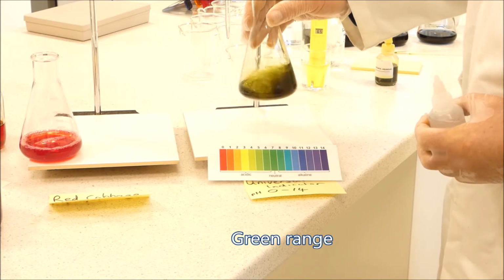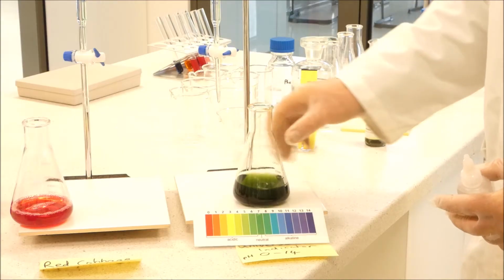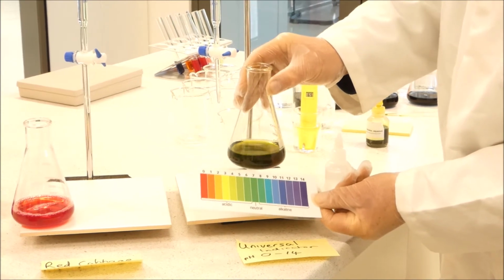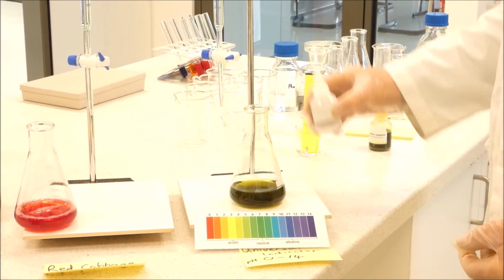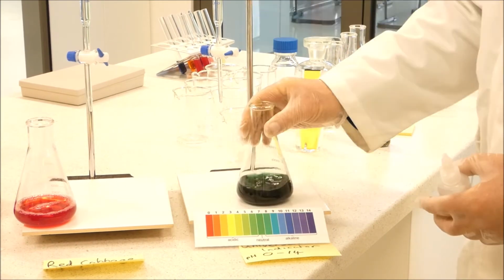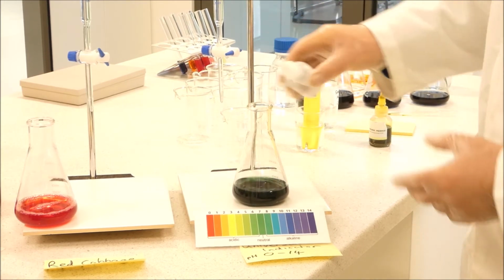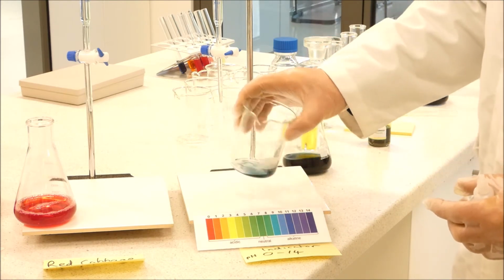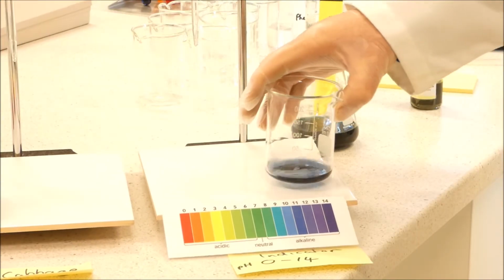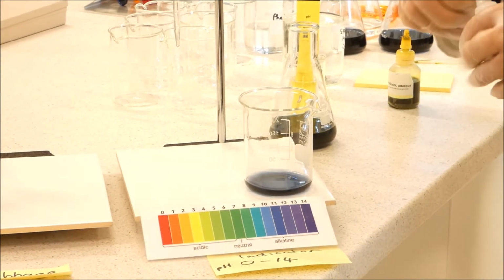Give it a good swirl, and you can now see we're definitely getting into the green stage, or the green part of the spectrum. You can see now that the green is becoming closer to the 7-8 sort of range. Now if we continue on, you can see it's getting quite blue now. Later on we'll do another experiment which actually shows this much more clearly, and we just put a whole lot more in now. So you can now see it's going into a much bluer colour. If we add enough sodium hydroxide, there you go, it's starting to go into very dark blue. So that was the full colour range for universal indicator.